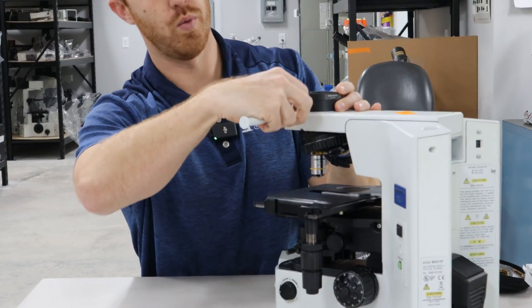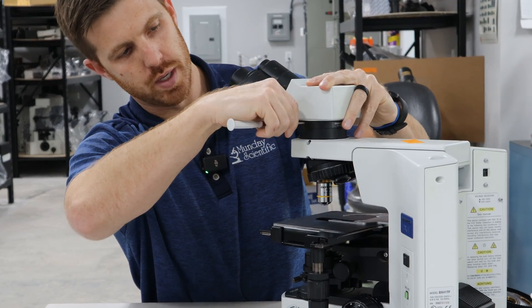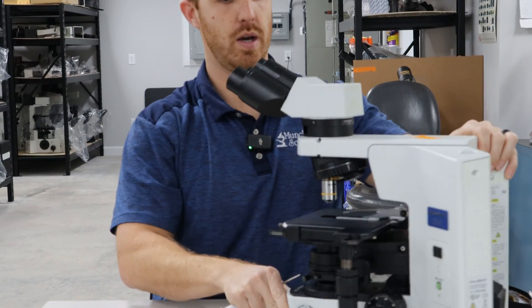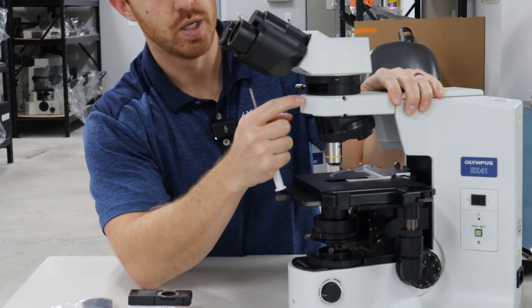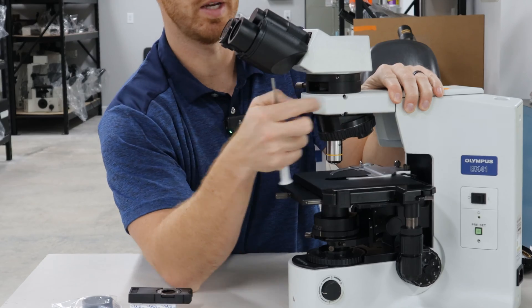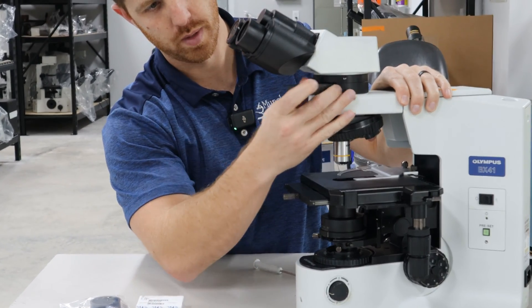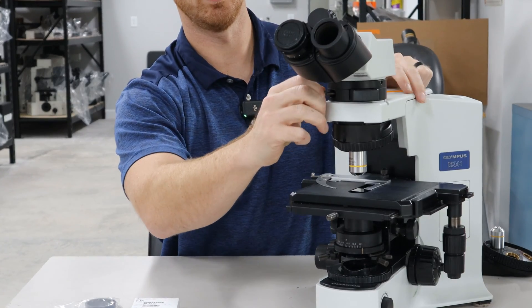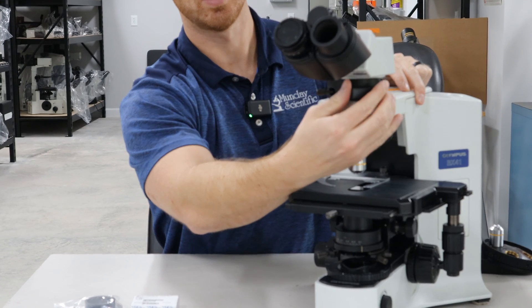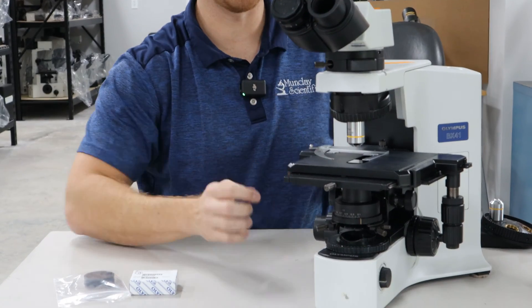It would go right underneath the head, and then you put the head back on. It's really important to keep everything lined up when you're using analyzer and polarizer — it just makes things easier. Make sure those screw holes line up right there. Then your analyzer will slide in, and there's a little screw here that'll keep it in the guideway so it won't hit the indentations improperly whenever you're putting it front and back.